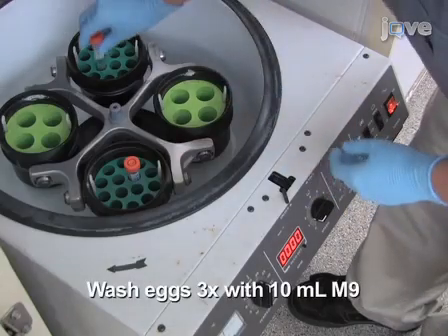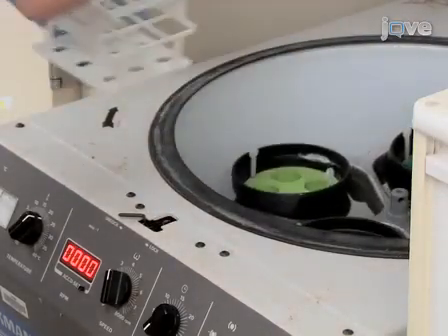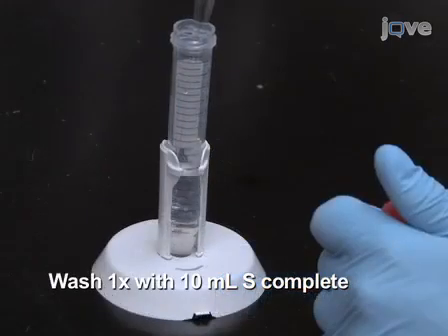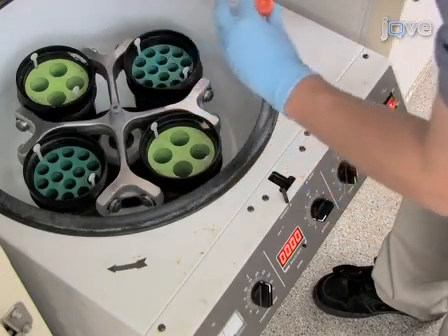Wash the eggs 3 times with 10 ml of M9 buffer by centrifuging for 2 minutes at 2500 rpm or 1100 times G. Then, wash the eggs once with 10 ml of S complete by centrifuging for 2 minutes at 2500 rpm or 1100 times G.